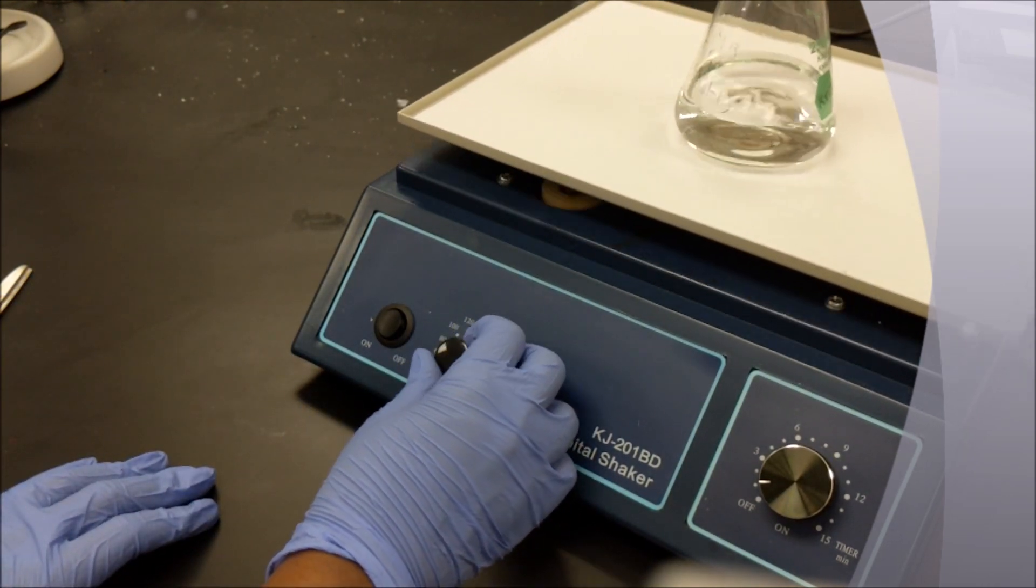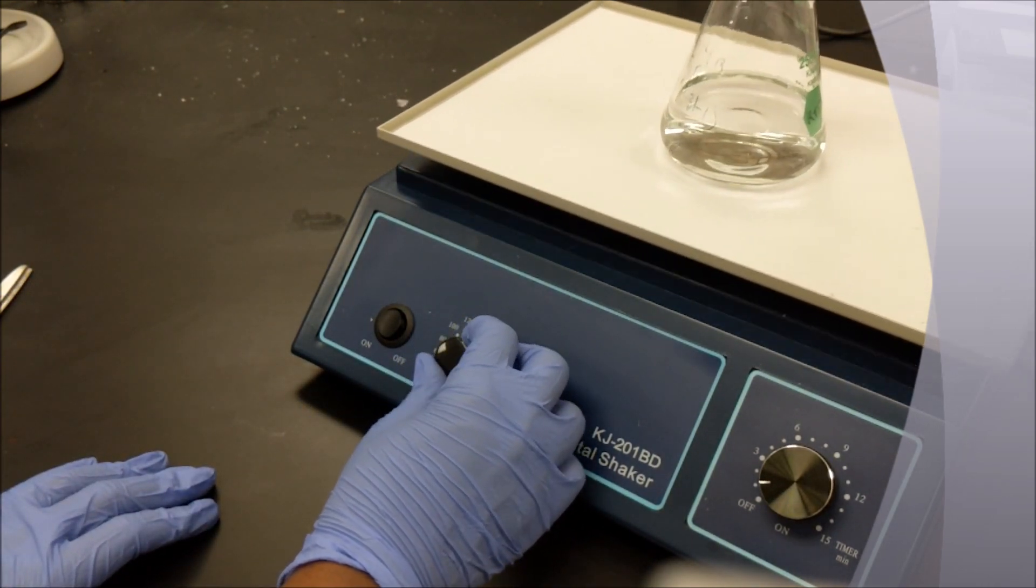When you're done, slowly decrease the speed.